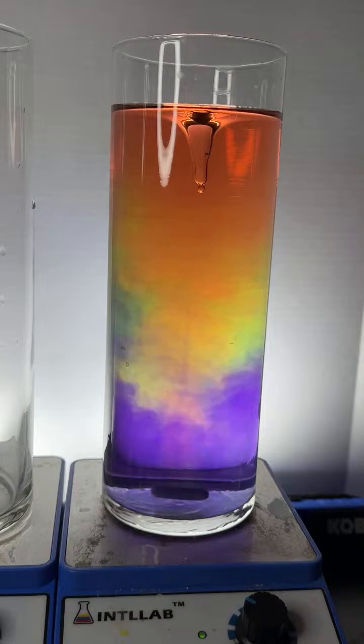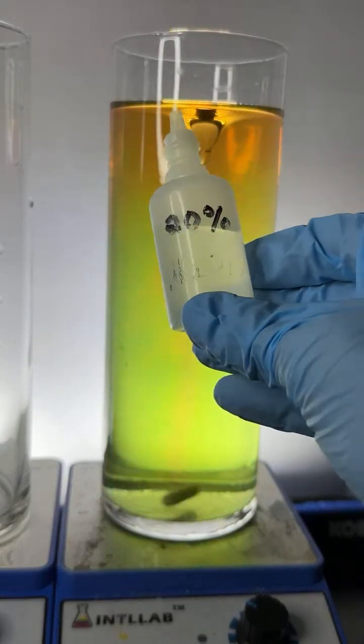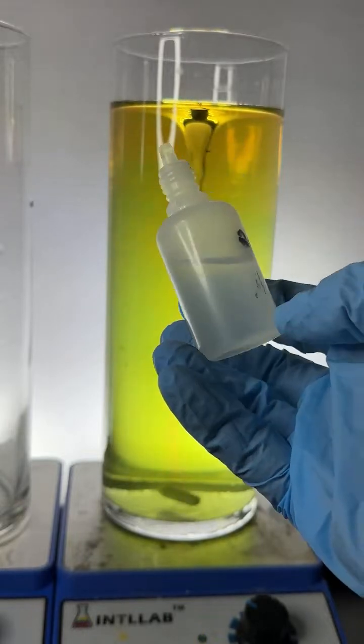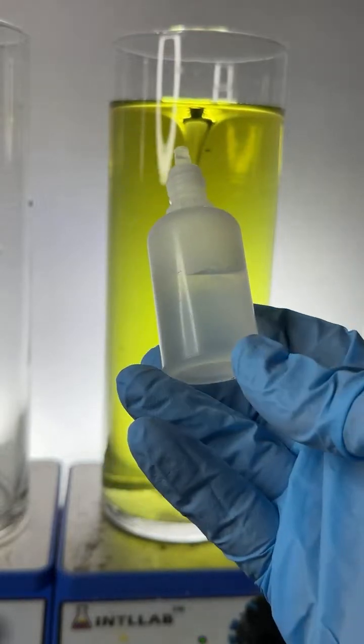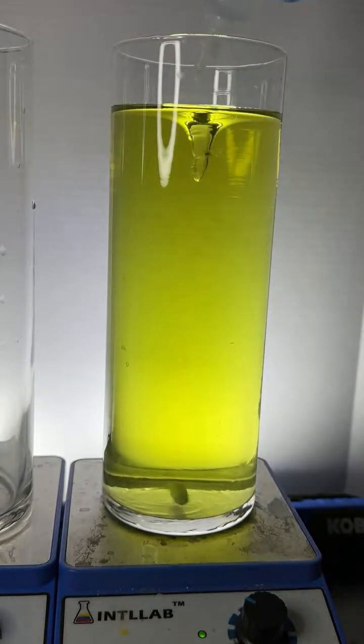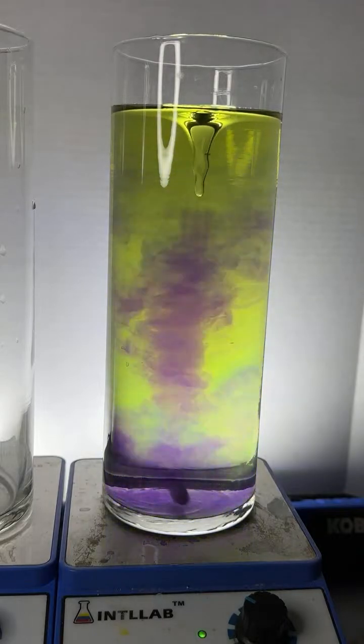What if you touch that? Will it burn your hand? Yeah, that's why I have gloves on. If this stuff here is 20% by weight lye, or 20% by weight sodium hydroxide, if I spill this on my hand, it's not like it's going to be an emergency or anything. But if I get it on there and I don't wash it off, I'll notice it later. It'll start to burn and itch a little bit.